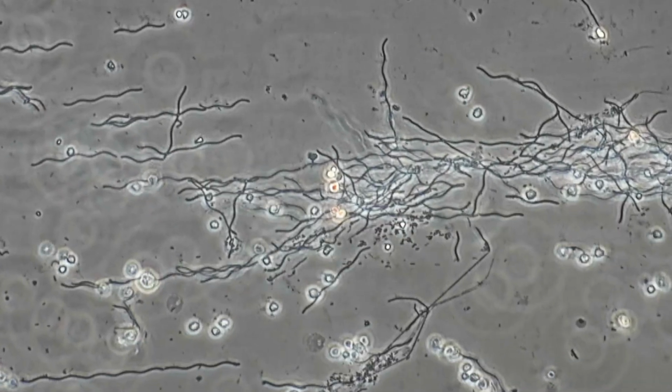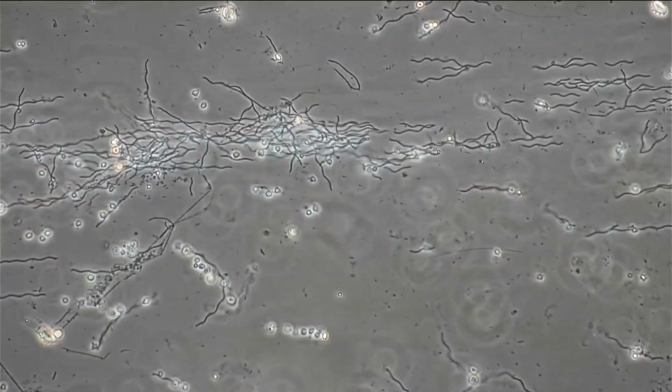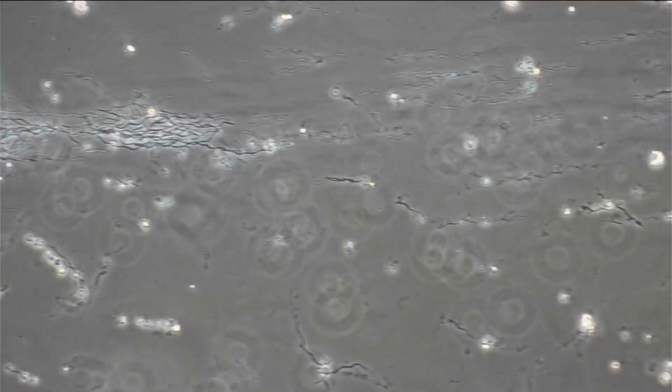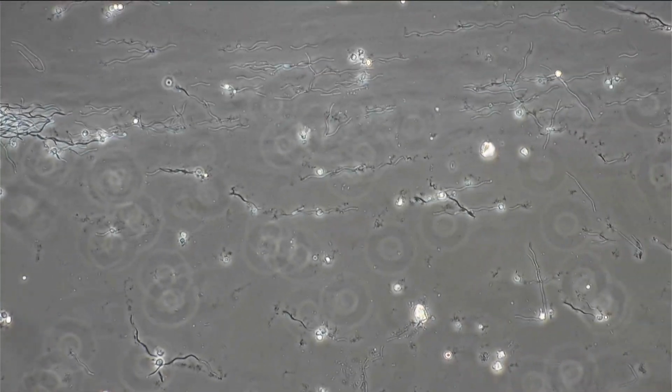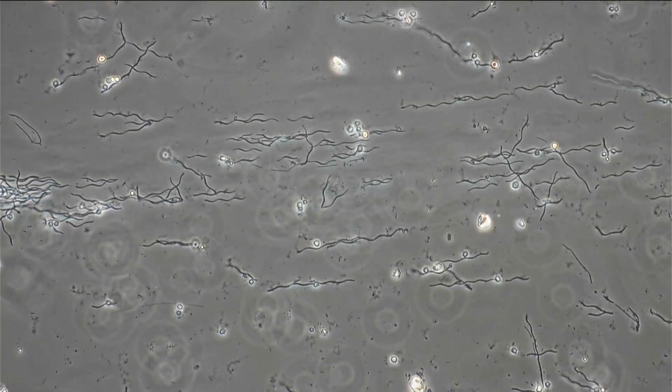And when you looked at those, then you could immediately see, wow, they stopped moving, right? Essentially, there was an instantaneous death. The hand disinfectant immediately killed off those cells, and they stopped moving quite quickly. And also at the different places of the slide, when you checked those bacteria, I could see all of them pretty much stopped moving. So essentially what I learned from that, this disinfectant works very quickly, right? It's an instantaneous removal of bacteria.